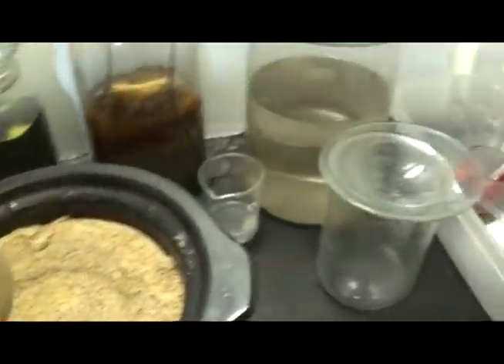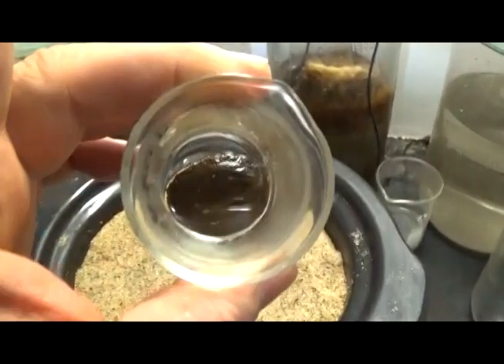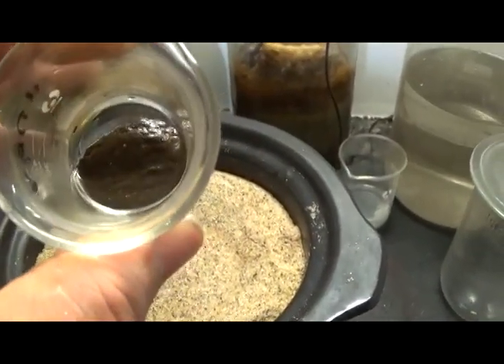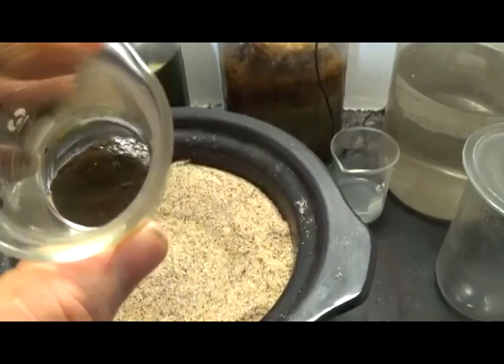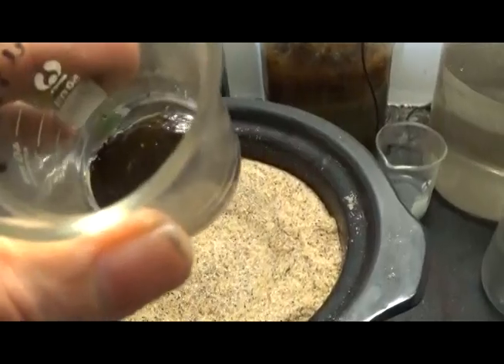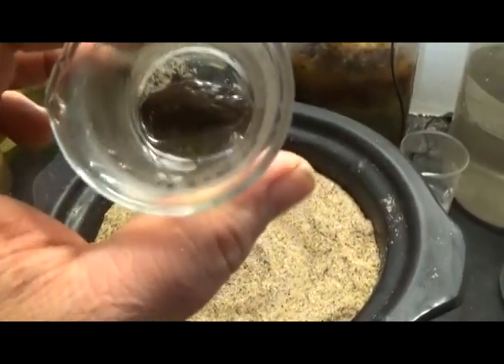I couldn't help it. I had to clean the stock pot out. That's fun. Anyways, it had some gold foils from RAM fingers in it. Well, they're in here now. In the ceiling there. I ain't gonna hurt nothing. Anyways, we're gonna get this dried out.